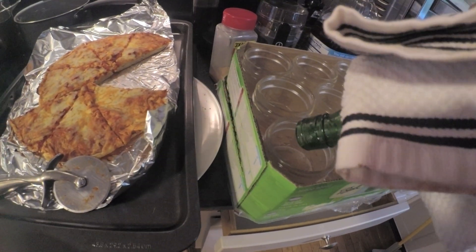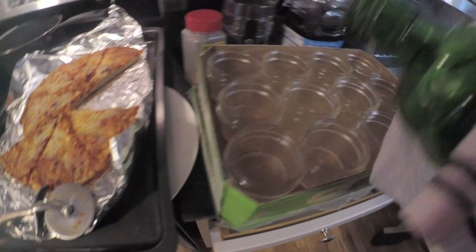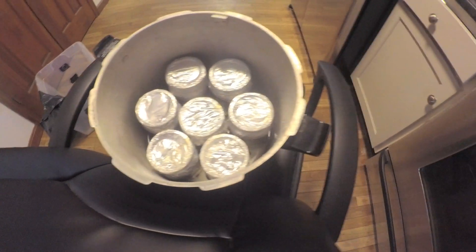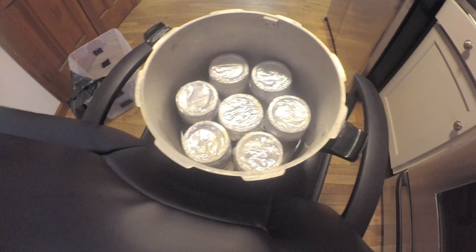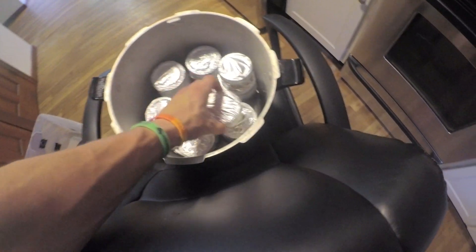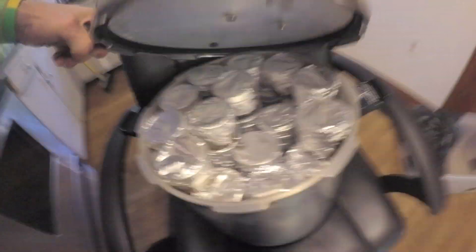Here I am just going back and finishing off this bottle. Next you want to grab your pressure cooker. I like putting some grain jars underneath it, then I just wrap my agar dishes and slap them on top.